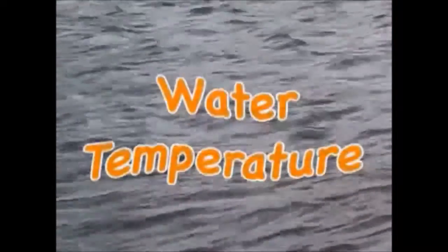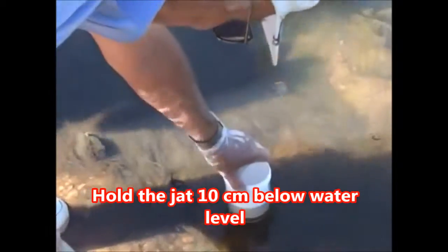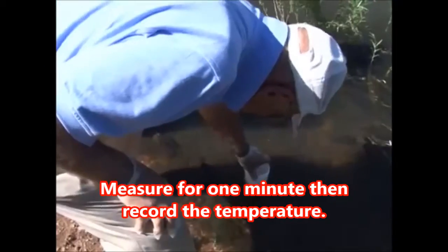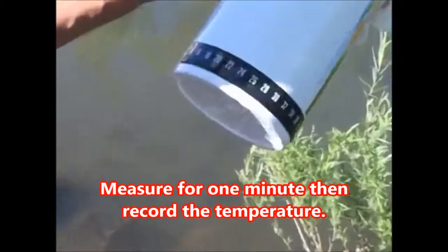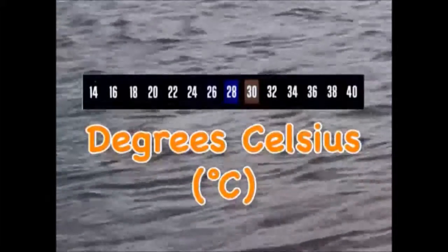The next test determines the water temperature. Next, hold your jar about 4 inches below the water surface. After 1 minute, remove the jar from the water and record the temperature that is highlighted on either strip. The temperature scale on the strips is in degrees Celsius.